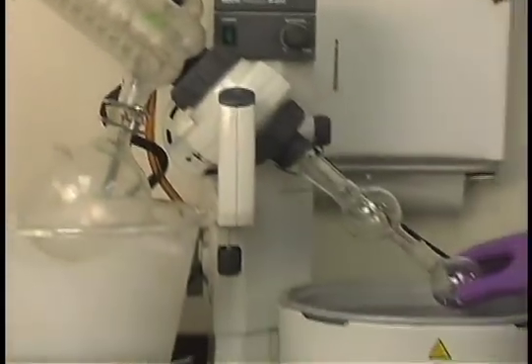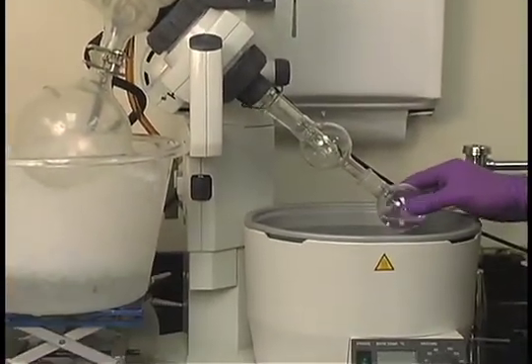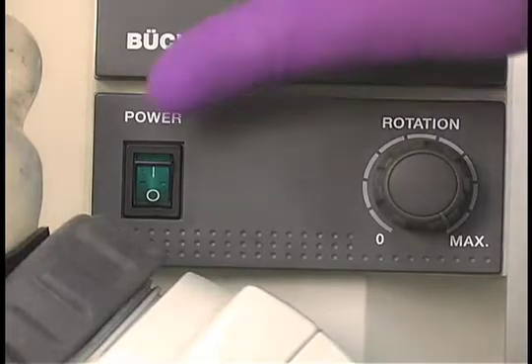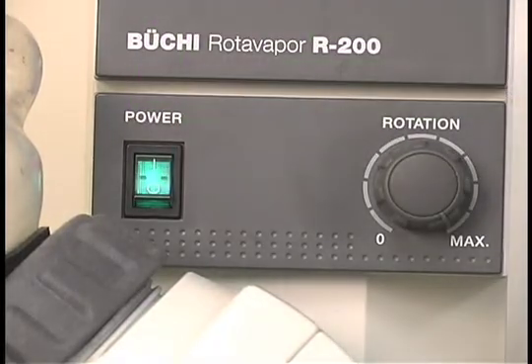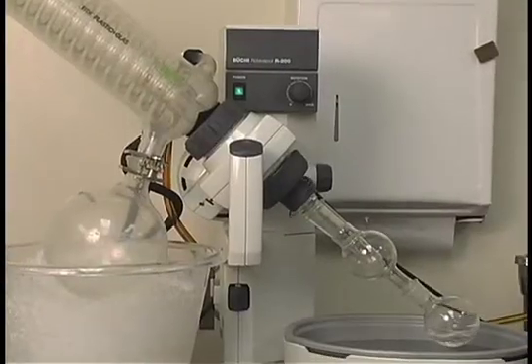Once this is firmly attached by the vacuum, turn on the power to rotate it. The rotation typically near maximum value is the appropriate setting.